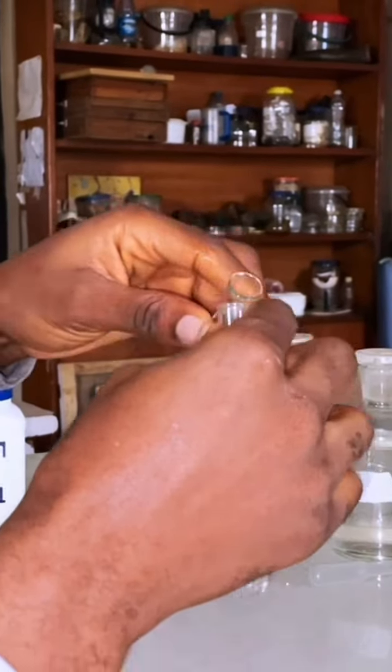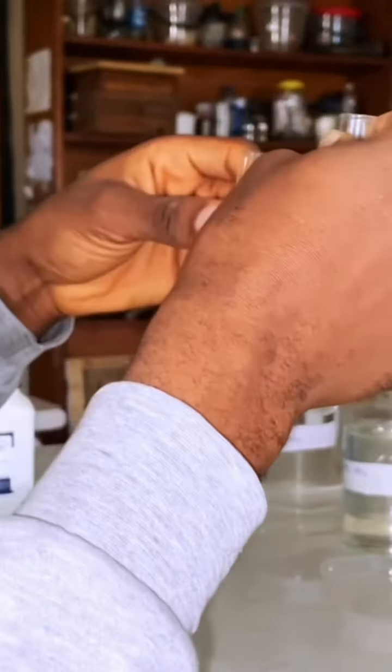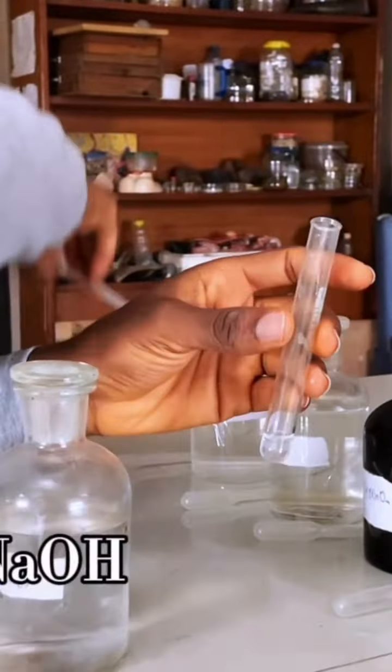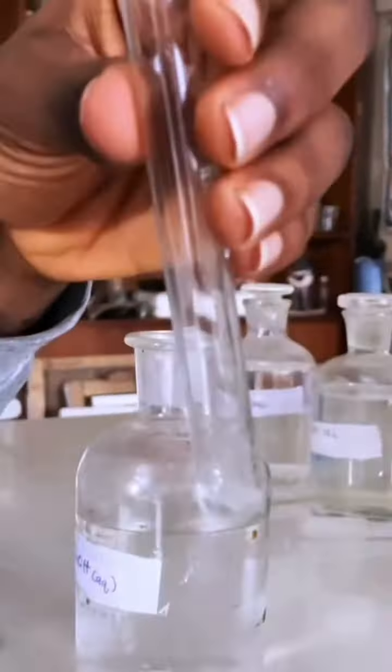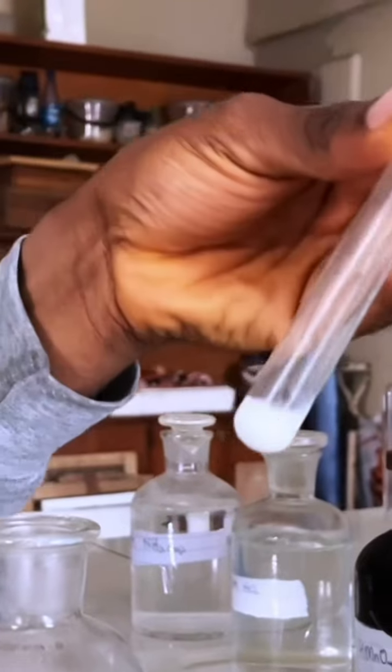So you'll be told to measure a particular volume, but here I'm just using very little. So I've taken a little bit of it. So I have my sodium hydroxide. I'll put a little, they said in drops. If I put a little of this, you can see a white PPT is formed, quite clear.